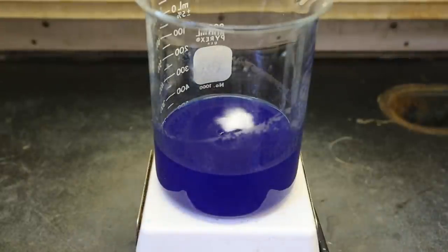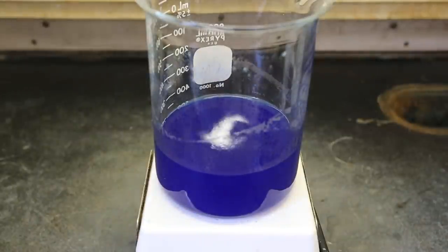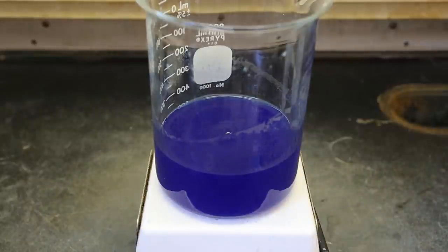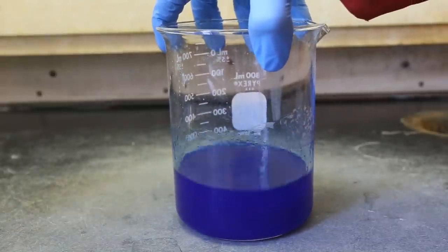After a while, you'll notice that the solution becomes quite viscous and the cotton has a hard time dissolving and getting wet by the solution. This should tell you that the solution is getting close to the saturation point. Do not add too much cotton, as we don't want there to be undissolved cotton fibers floating around in solution. Here we can see that the solution has become quite viscous.